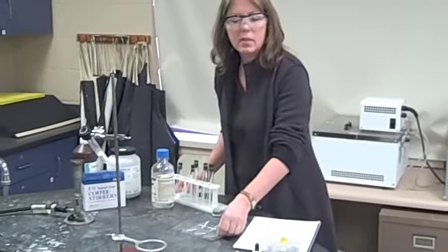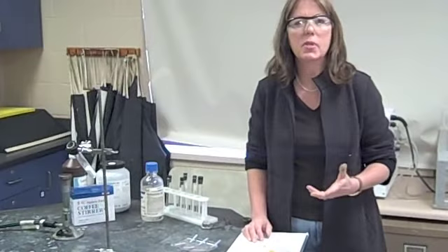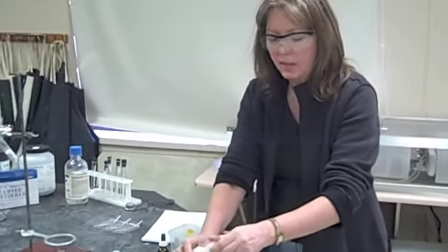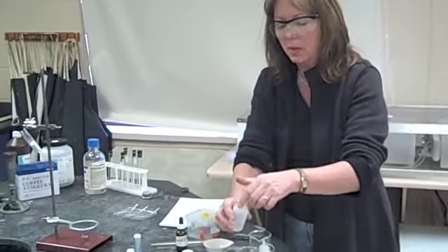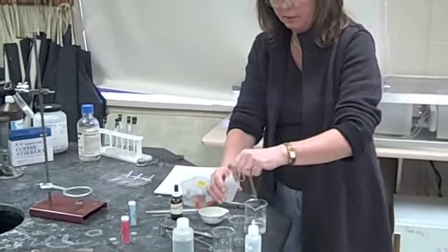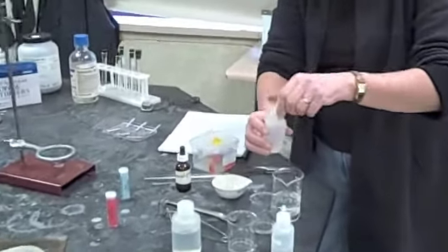The first thing that I wanted to talk about, perhaps you remember from middle school, the proper procedure for testing acids and bases. I'm going to put a chemical into this beaker. I'm not going to let you know what chemical it is. I could have had an unlabeled one. I'm putting one there. I'm putting another chemical here. And in the third beaker I have yet another chemical.